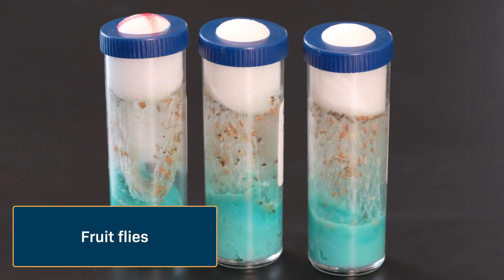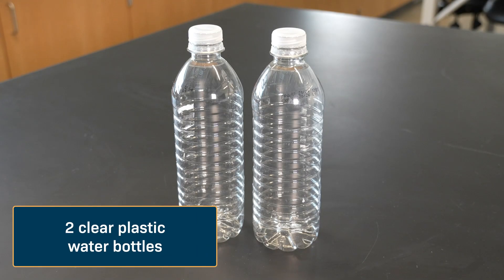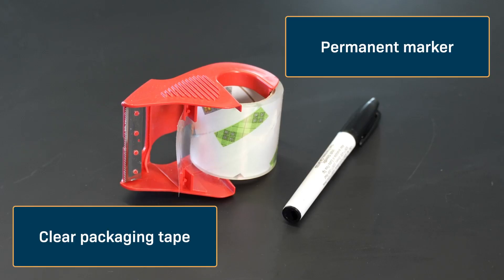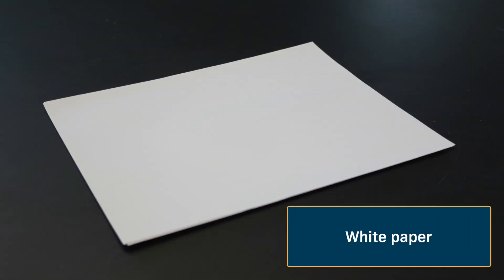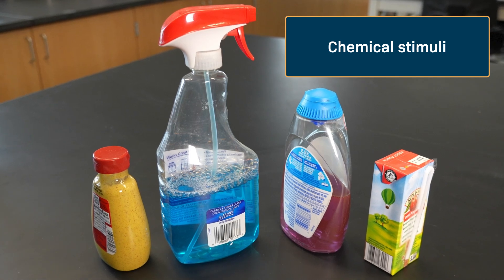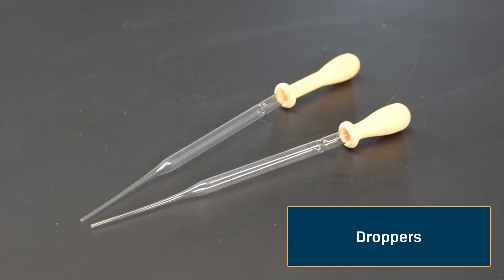I'll walk you through how to set up an experiment that will test chemotaxis behaviors in fruit flies, and then leave you to design your own experiment to select which chemical stimuli to test. You'll need: about 40 fruit flies per experiment, ordered from a biological supply company; two matching clear plastic water bottles, dry with labels removed; extra water bottle caps; a box cutter; clear packing tape and a permanent marker; a small funnel; cotton balls and scotch tape; white paper; distilled water; various chemical stimuli of your choosing — I've got a fun selection of foods and cleaning supplies; droppers, one for each stimulus; and a timer.